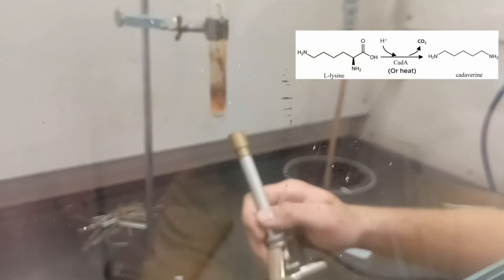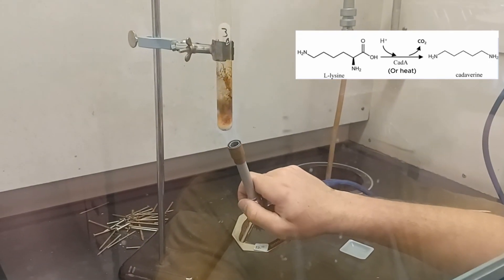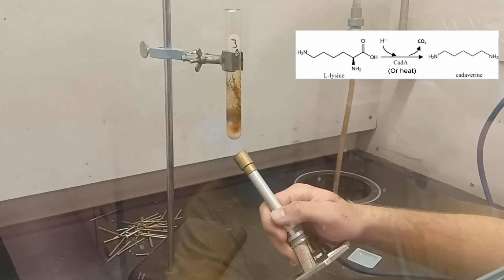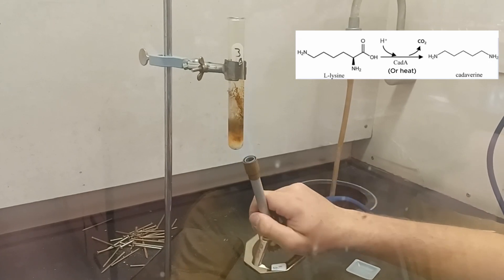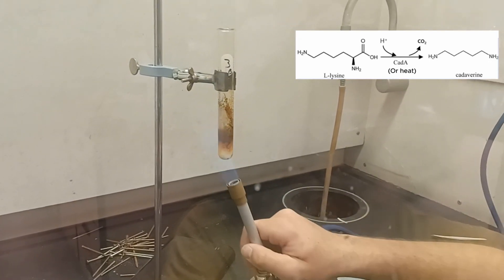What is happening is called a thermal decarboxylation, which is a type of reaction where something is heated and gives off carbon dioxide. In this case, the carboxyl group on lysine is being broken away to form cadaverine.